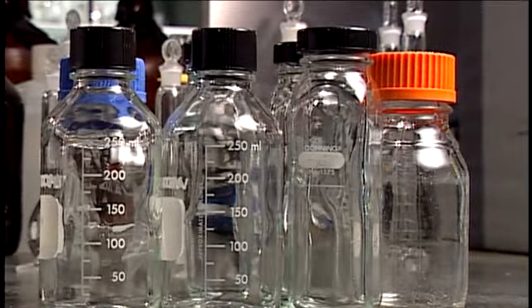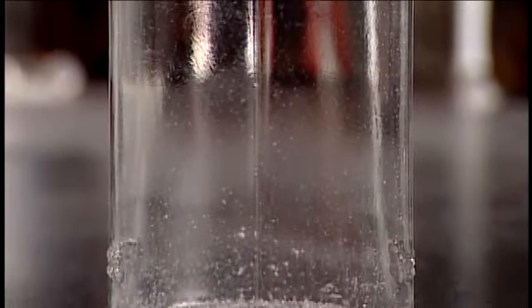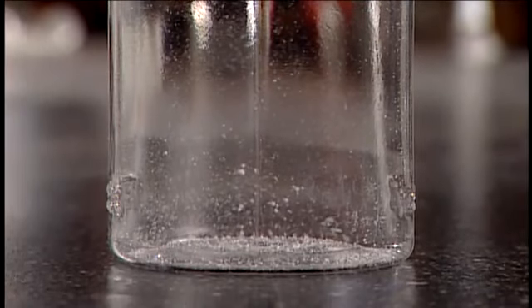Sample bottles must be free from contamination and, when required, contain the proper preservatives for the specific type of analysis.